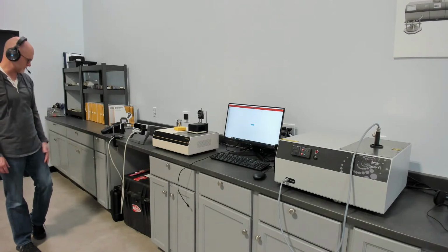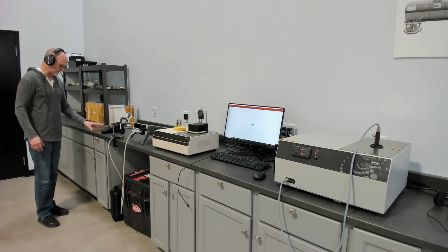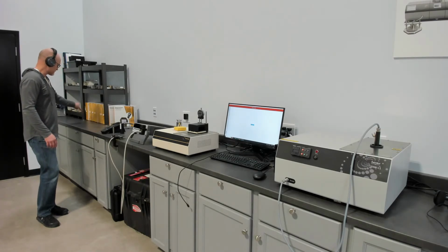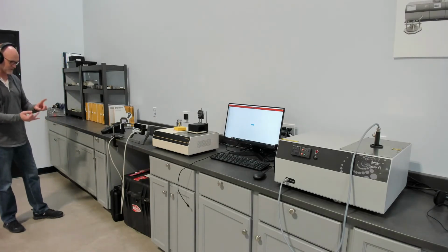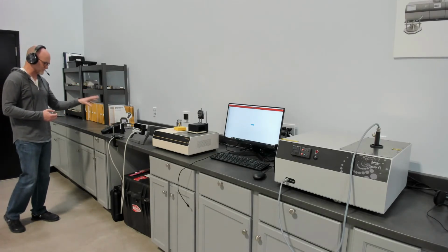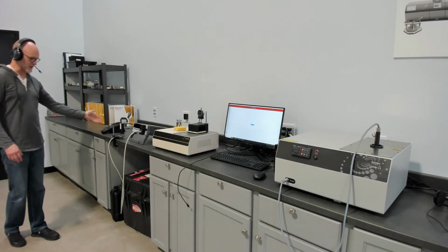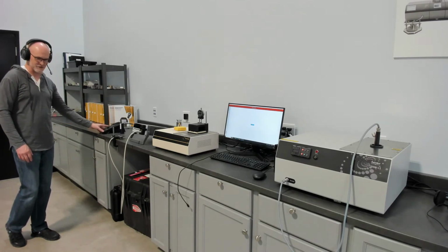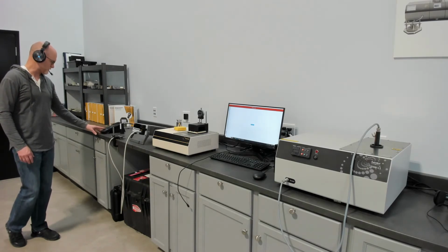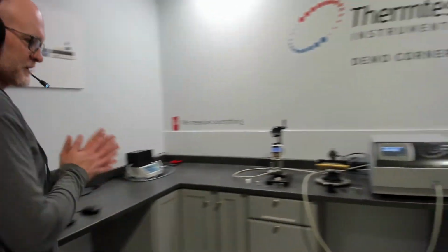So that's our TPS3. And then our MP2, which is our baby measurement platform, our entry level. This combines multiple sensors that are designed for solids, pastes, and powders, all absolute measurements, so high accuracy, but with more narrow range, operated off battery or wall power. So it's a great entry level instrument with all the same theory followed by all of our laboratory instruments, just with a smaller range. That's a bit of an explanation.